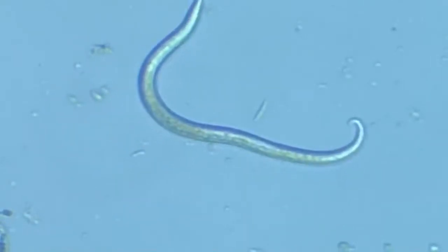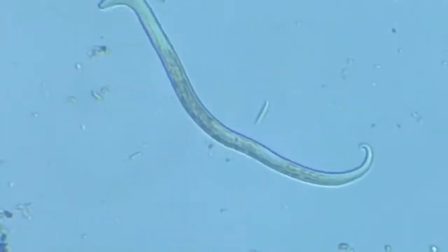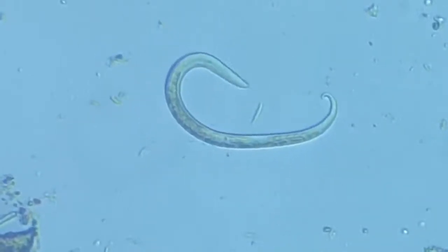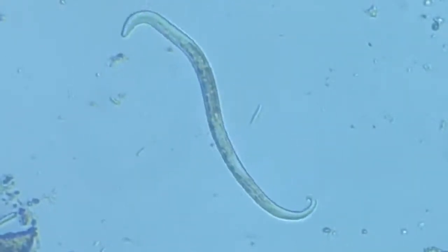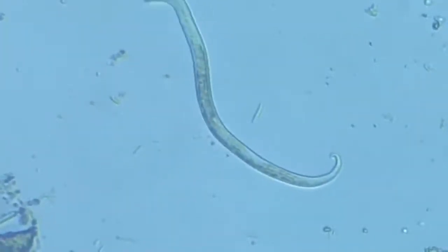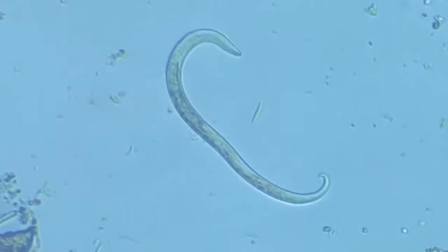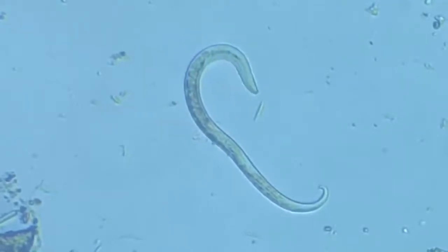And in the center, we see the body organelles, primarily the stomach, the food items. Then there is the alimentary canal, which is slightly twisted, and at the last third end, we again see some high degree of density of organelles. Now, since the posterior end is ending in a hook-like shape, I presume this to be a male.